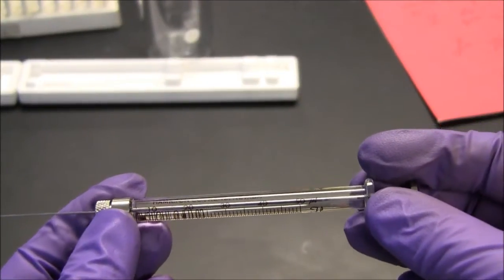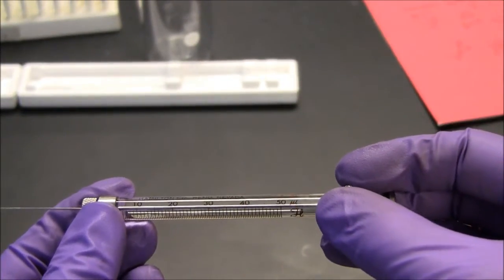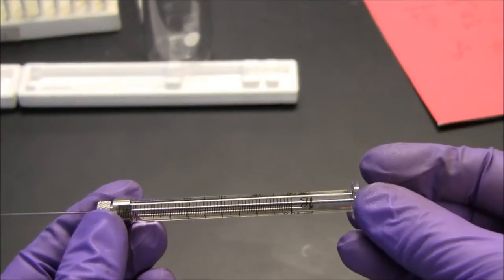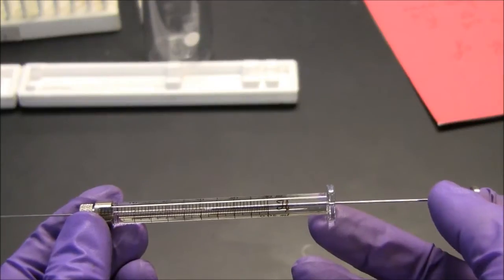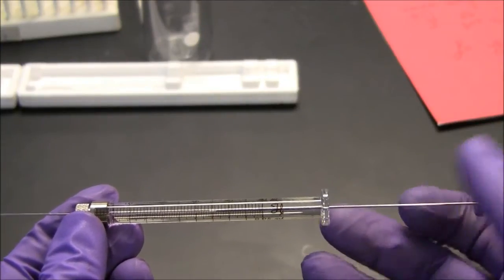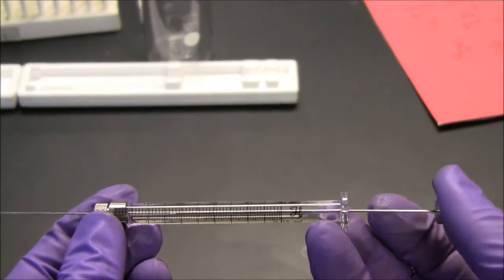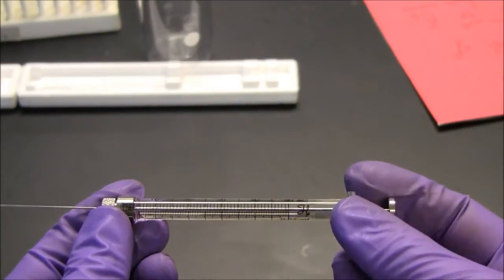This syringe is a 50 microliter syringe. I can pull on the end here and there is a plunger inside that you can see. Right now I'm just pulling in air, but it should move very smoothly.